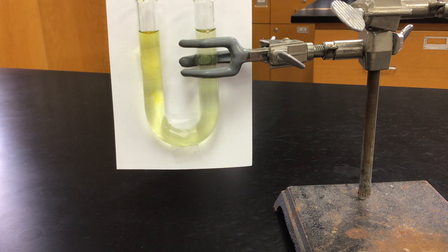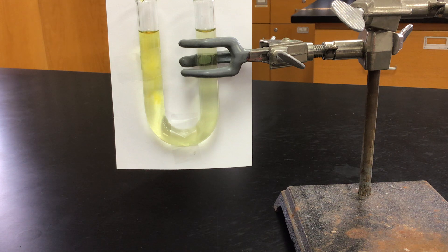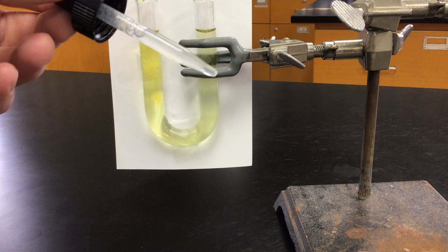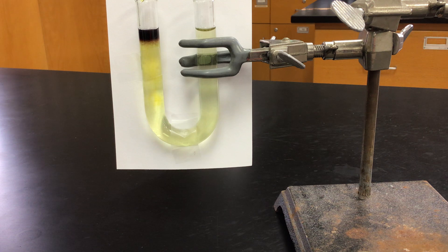So first thing I'm going to do is test for iodine. I think this side of my electrode has gotten darker, so I think that's where the iodine was. I've got a little dropper of starch. I dropped that in there. And we see it turning purple, so that tells me that there is some presence of iodine in there.